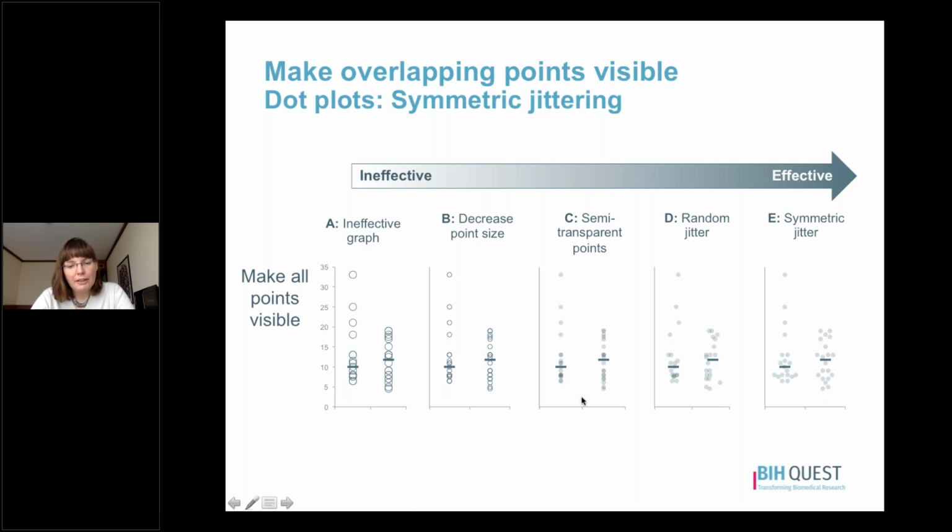Our third option is to make the data points semi-transparent. So now regions with more data points show up darker than regions with fewer data points. This is a helpful strategy, but again, if there are too many data points, then at some point that region will stop getting darker, it will be fully saturated, and it can still be a little bit hard to assess the data distribution. A next strategy that we can use is called random jitter.